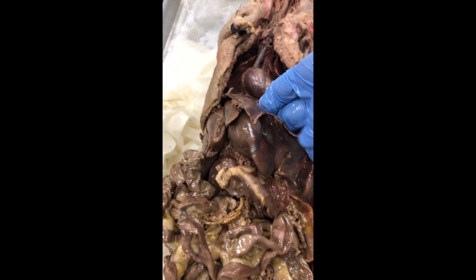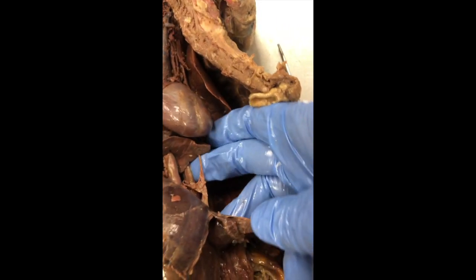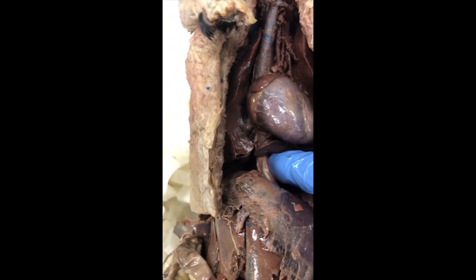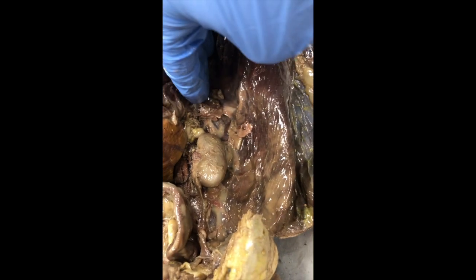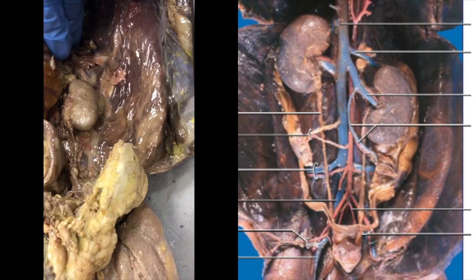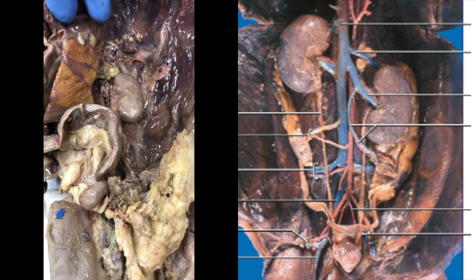Right. Here's our diaphragm again. There's our descending aorta, so it might be difficult to see. That's our inferior vena cava. That's our descending aorta. The descending aorta comes through pretty deep back in all this mess right here. So it comes back in right here. I apologize for the poor quality of this, guys. It really stays right on top of the spinal column all the way down.